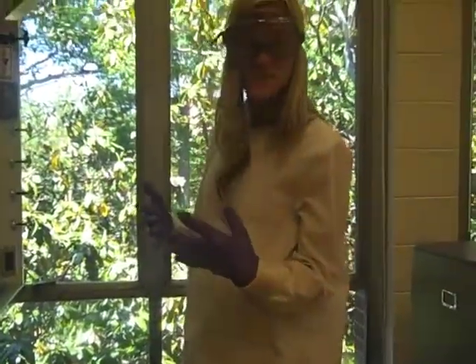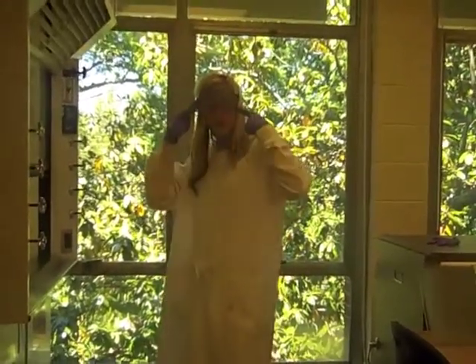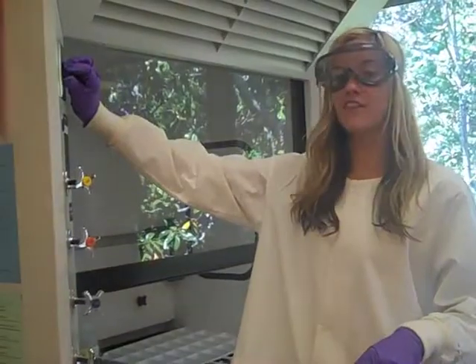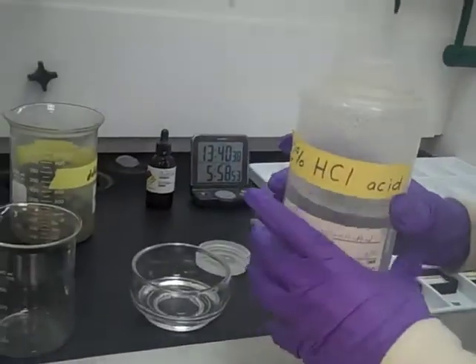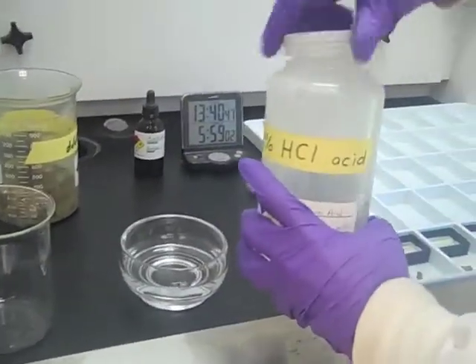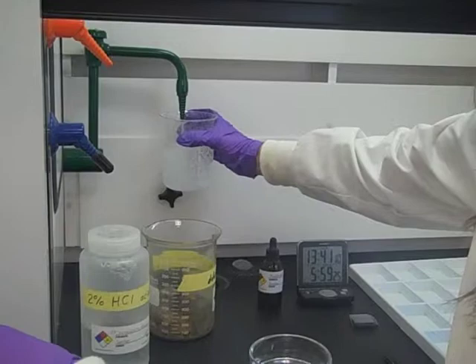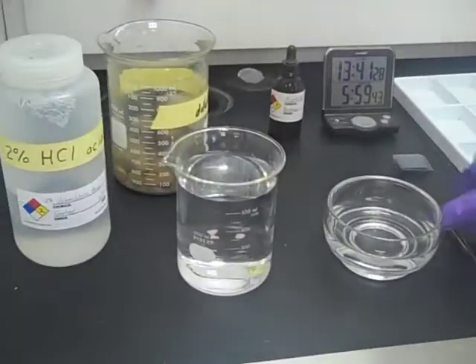Safety check! Before we start the etching process, you want to make sure you suit up in full lab gear — always practice safety first. Notice I'm wearing my lab coat, my gloves, and my goggles because we're going to be working with a hydrochloric acid solution. Since we're going to be working under the hood, we need to make sure we prepare the hood — all you have to do is turn it on and then turn on the light. First, we want to pour the acid into our little acid jar, carefully screw the lid back on, and set that to the side. Then we're going to fill this beaker with some fresh water. Now we're all prepared and ready to start etching.